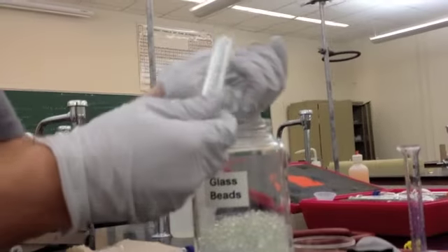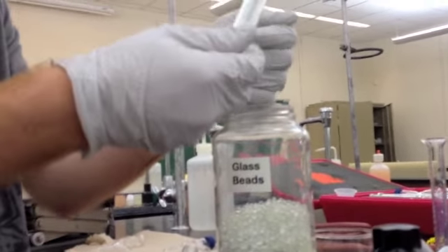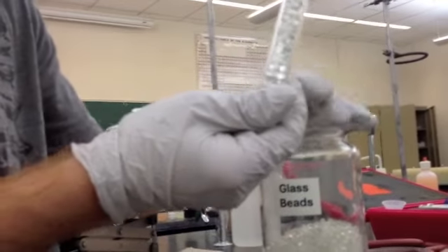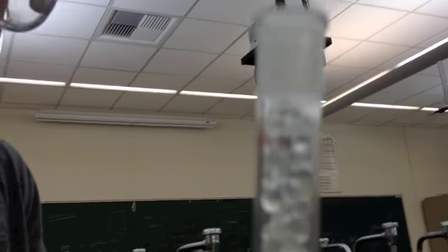You want to make sure you haven't added too much. Right now, that's way too full. You want to have this much space from the top to the bottom, just so you can secure your apparatus and so it won't take forever.